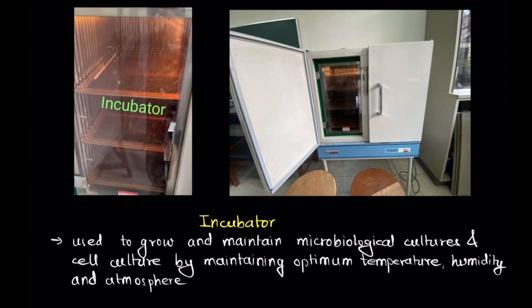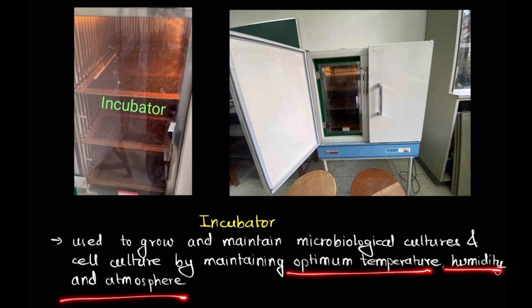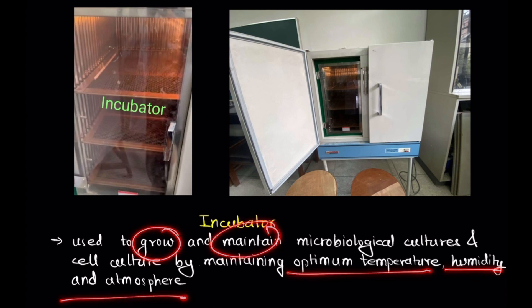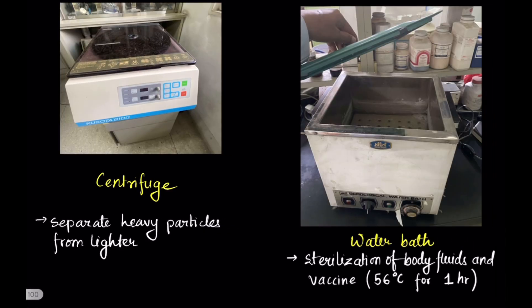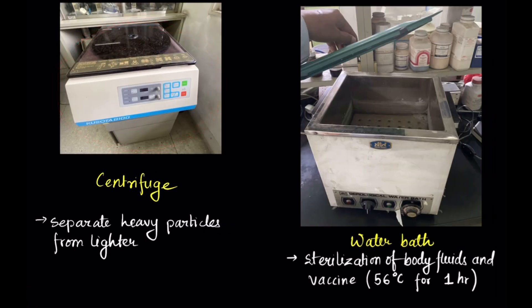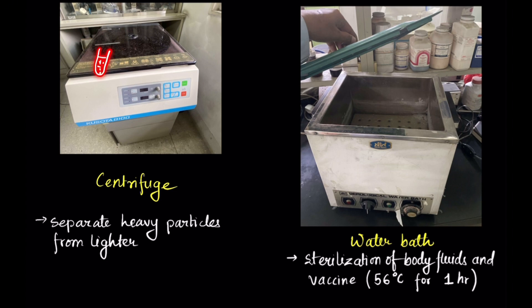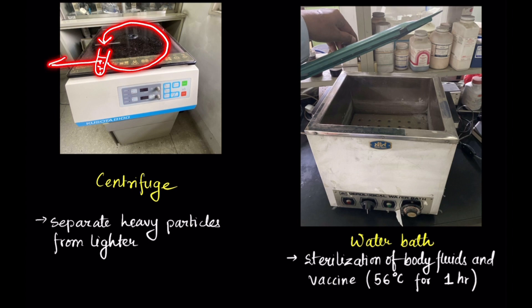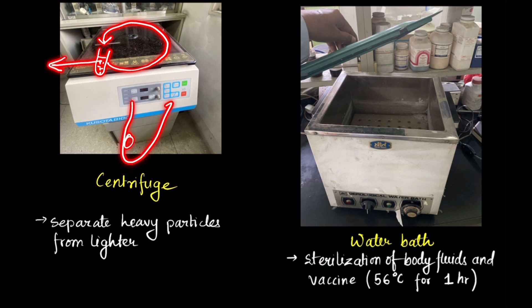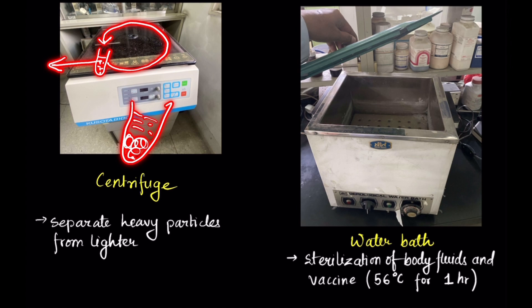Incubator is a machine used to maintain optimum temperature, humidity, and atmosphere in order to grow and maintain microbiological cultures and cell cultures. In a centrifuge, a test tube with some medium is spun at high velocity, and due to centrifugal force, the heavier particles settle down while the lighter particles remain at the top.